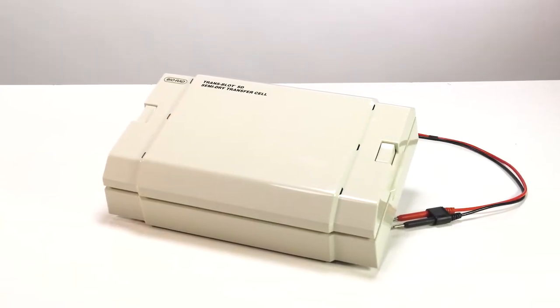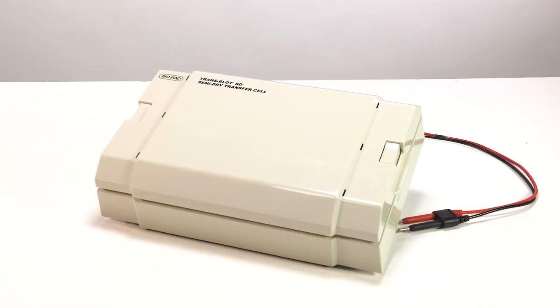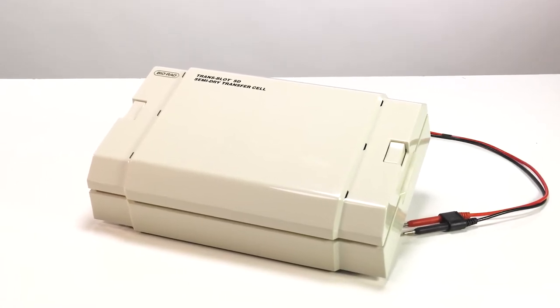In this video, we will show you how to assemble a blotting sandwich for the Transblot SD Semidry Transfer Cell.